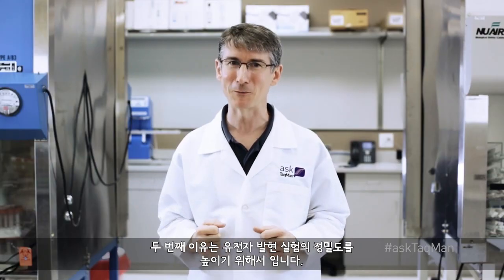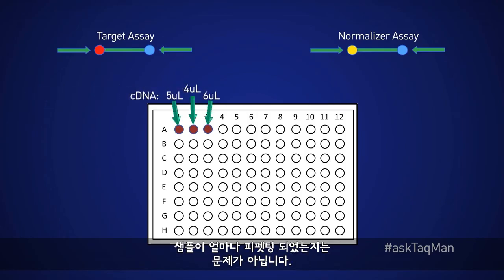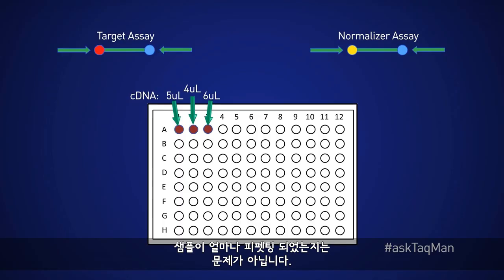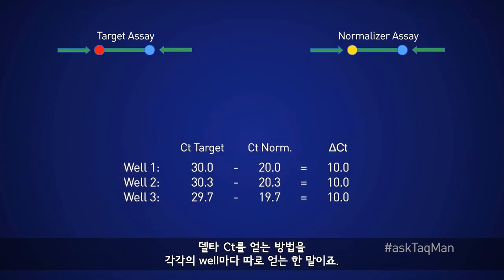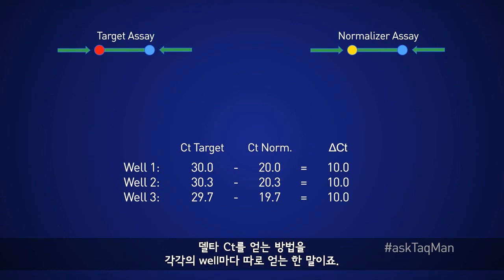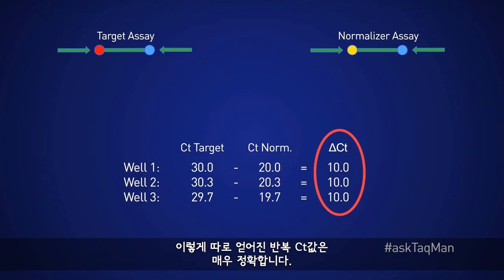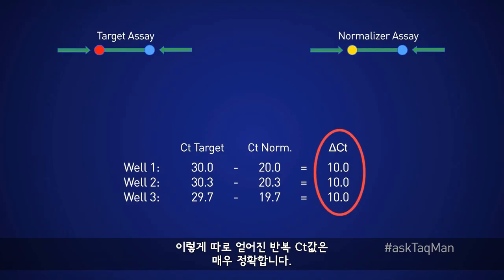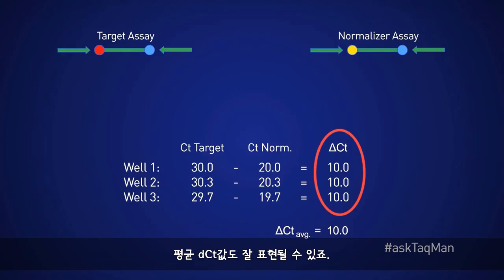The second reason is better precision in gene expression experiments. In other words, if the target gene and normalizer are in the same tube, it won't matter if the volume of sample that's pipetted is a bit off among replicates — as long as delta CT values are calculated by normalizing the target CT to the normalizer CT for each well individually. Taking this approach leads to delta CT values among replicates being highly precise, meaning the average delta CT can be expressed with great confidence.